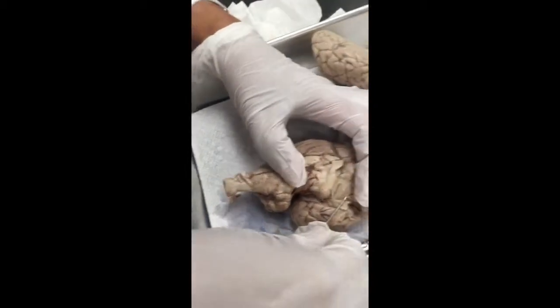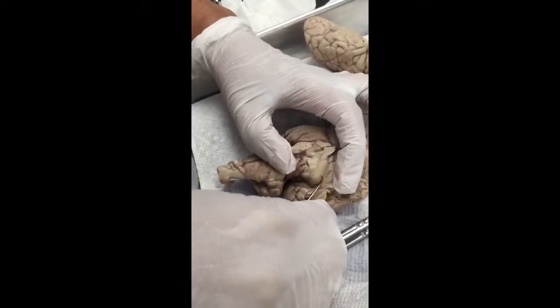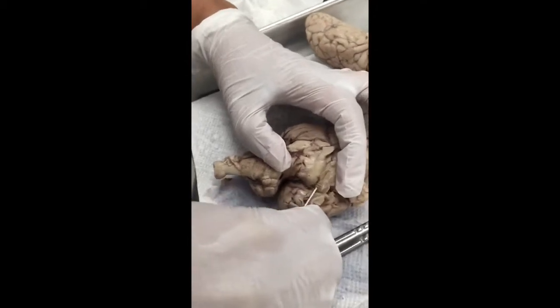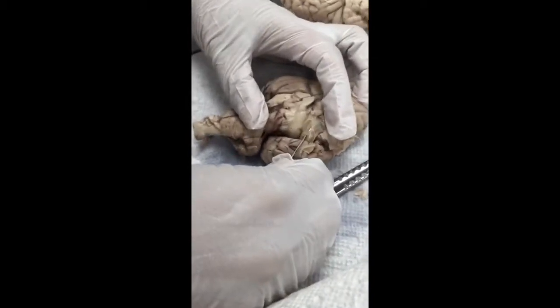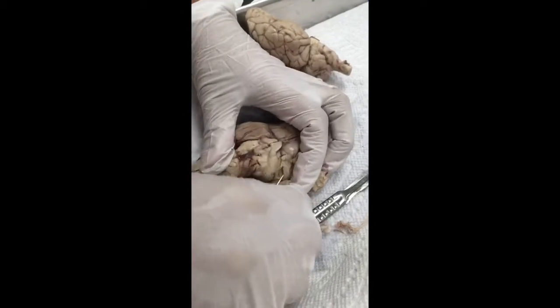This is one. Is that accessory? No, that's trigeminal. This is two. I don't know where the third is. Oh, here is the three. You look at them. That's the trigeminal. You just follow. You see, and that's the trigeminal.